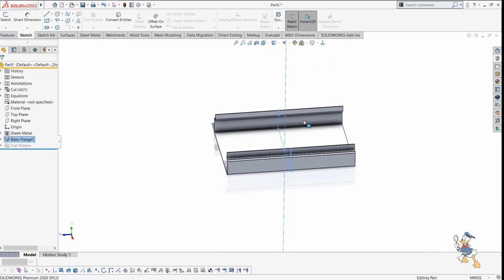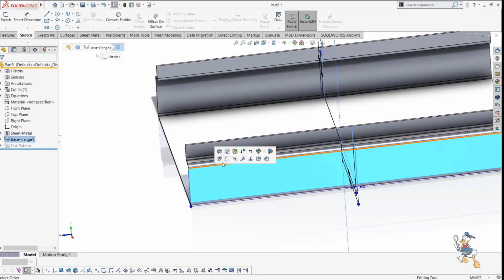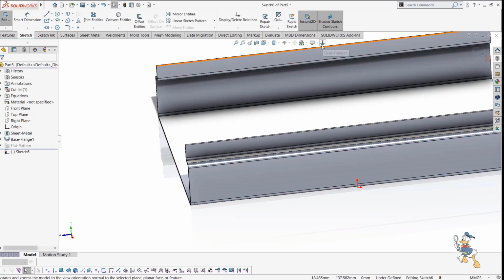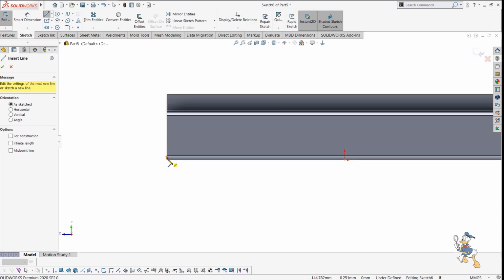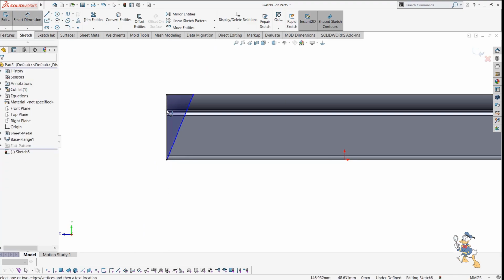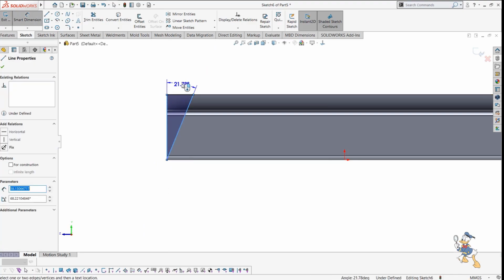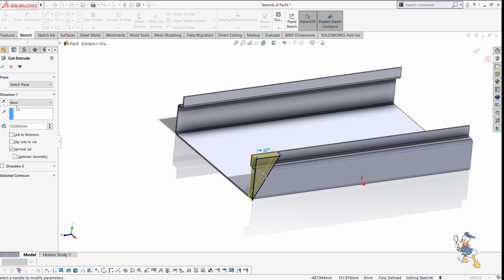So now the sheet metal component base flange feature is ready. This is the basic feature which you need to start with for the sheet metal component, the base flange command. Here we have also designed bending as well, but right now we don't need to design a bend because in the sketch itself we have done some bending. So Solidworks is a smart software which does many of the work on that basis.